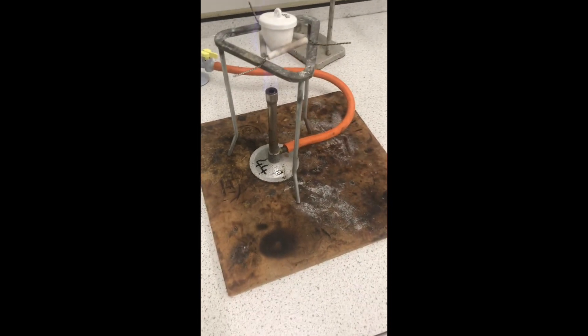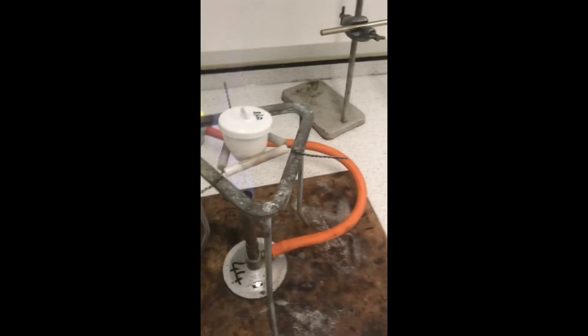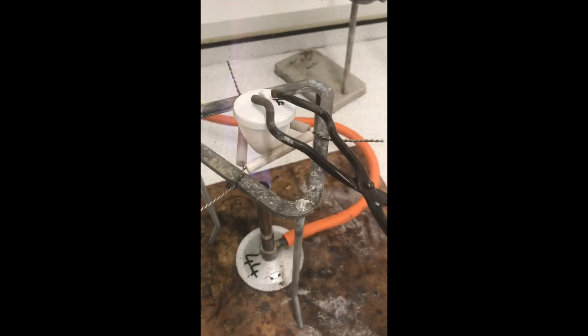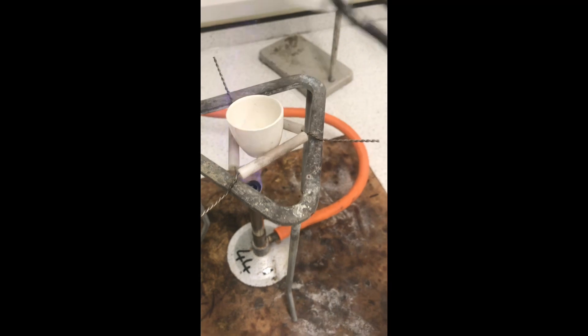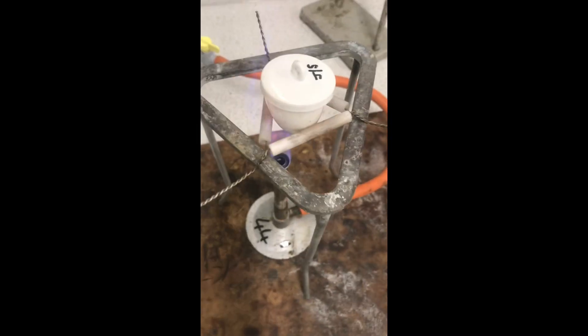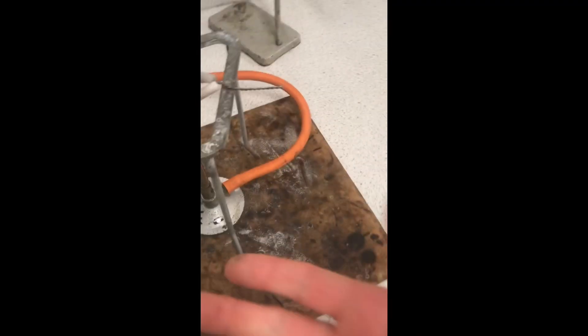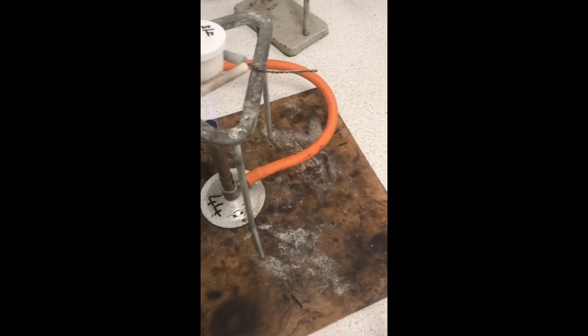Now, I must be careful while removing the lid, as I don't want any of the magnesium oxide to come flying out. While I'm removing the lid, let in a small amount of oxygen, and placing it back. It's important we do this about every 30 seconds so that the magnesium has sufficient oxygen to react.